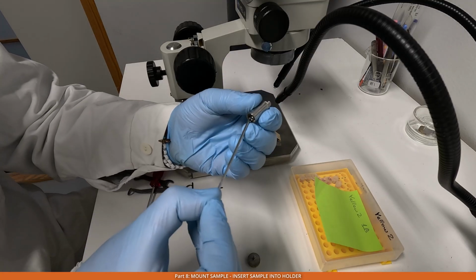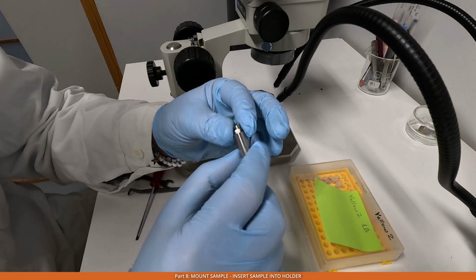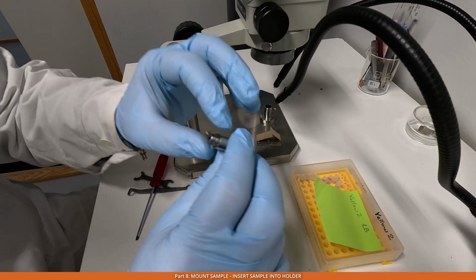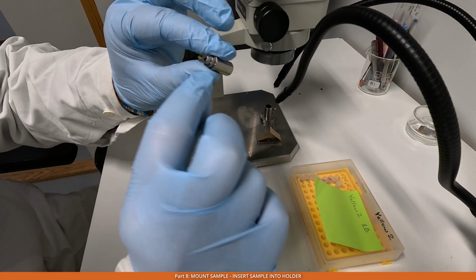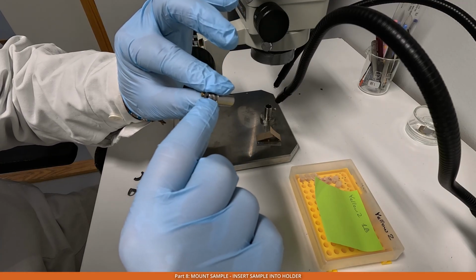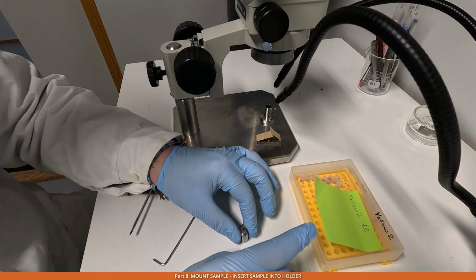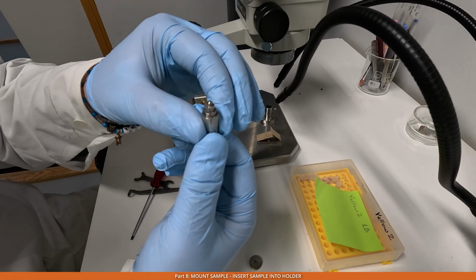What we do first, we make sure that the screw at the bottom of this holder is undone and all the cylinders can be rotated. Then I rotated them so that they are all on the same line, and these dots, all these 3 dots, are on the one line. And then I can put my sample on the top of it, like this.